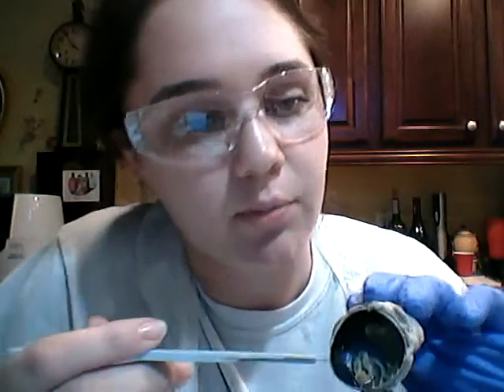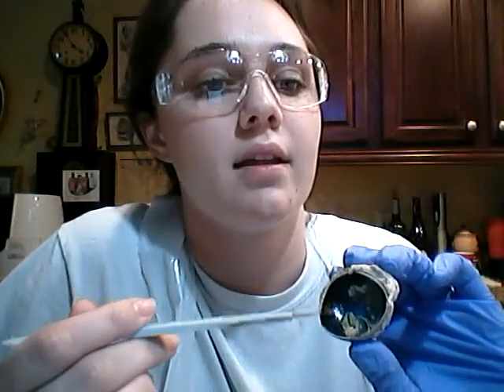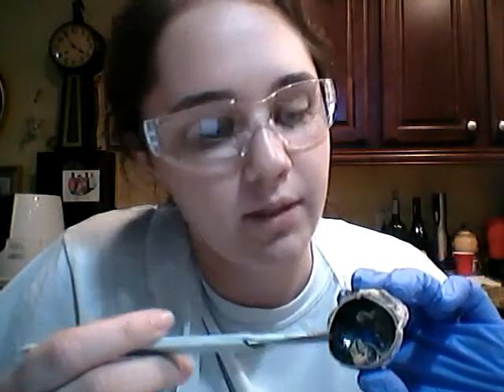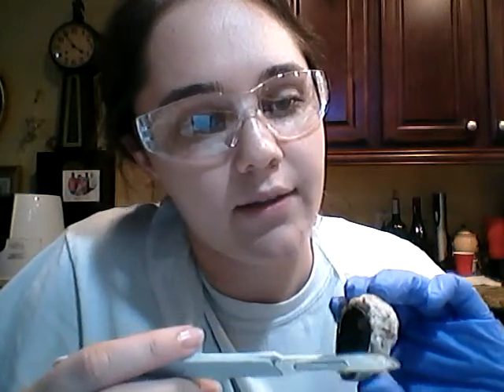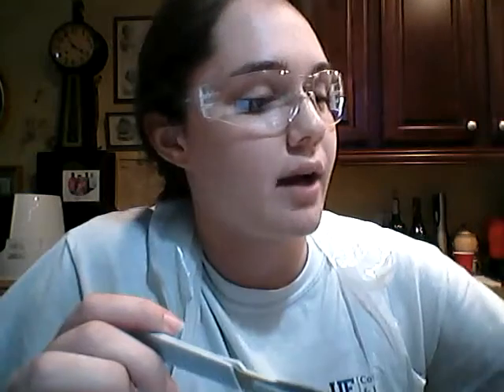And you see in here this blue and black shiny interior portion. This is called the choroid. And this white area out here, this is called the sclera. Okay, and inside the posterior cavity, there is this gelatinous fluid called the vitreous humor.